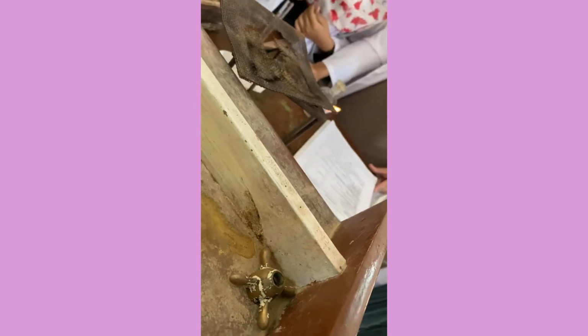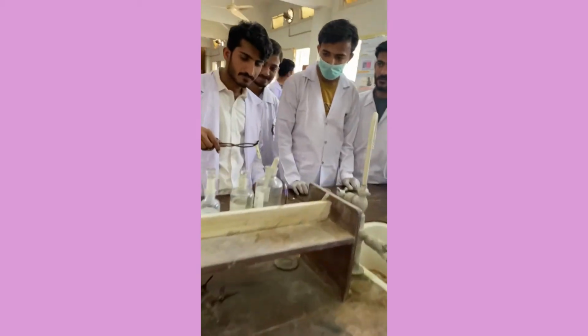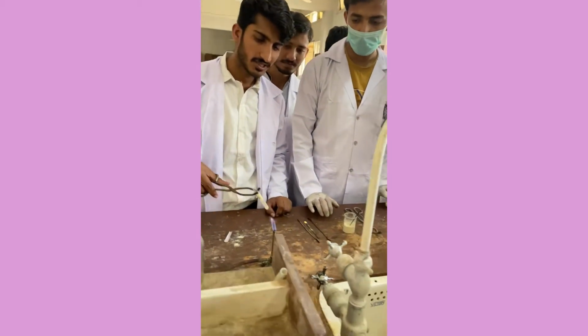If nitrogen is not there, which indications are you supposed to follow? It's written in your scheme. Just go step by step through the scheme. Great. What step are you on? The solubility test. Okay.